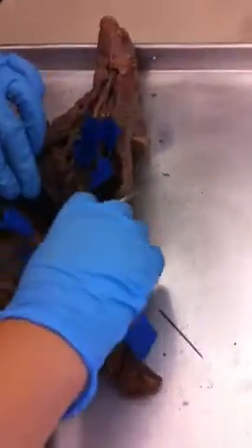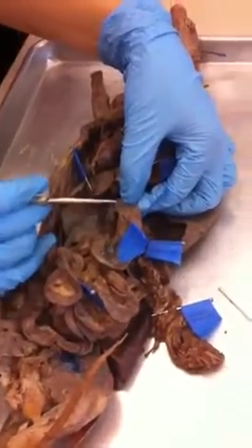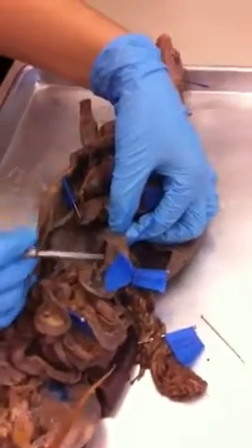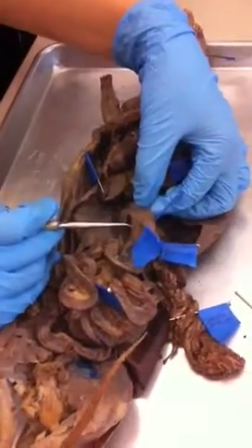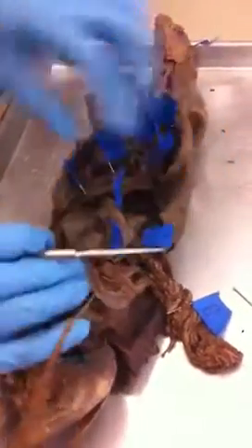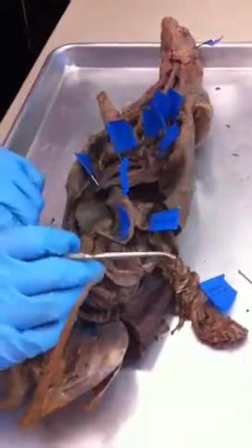Then here, come to here — stomach, duodenum, you can see. And then there is a strip here. This is the pancreas, strip. And then small intestine, large intestine — all the structures, see.